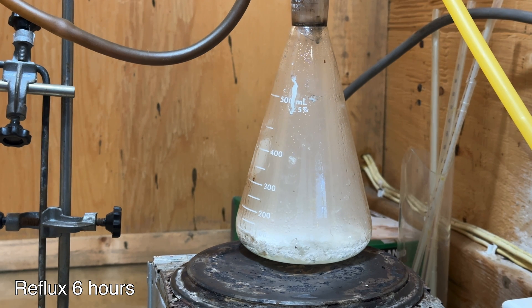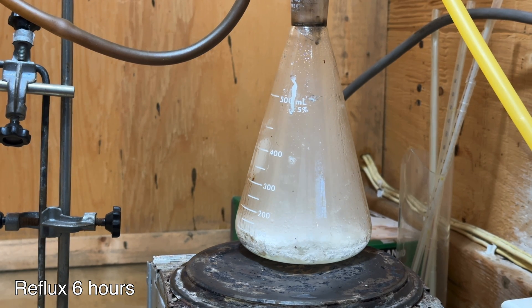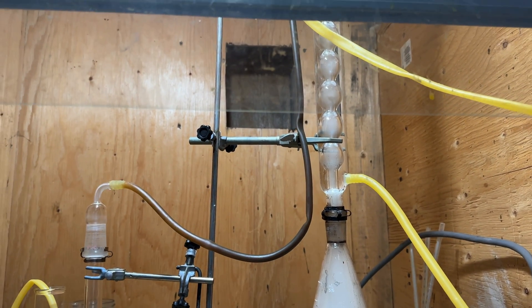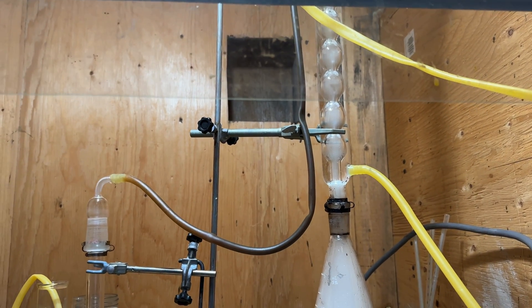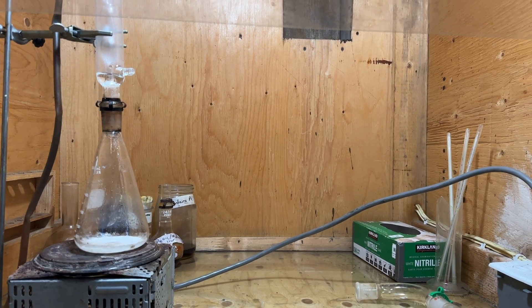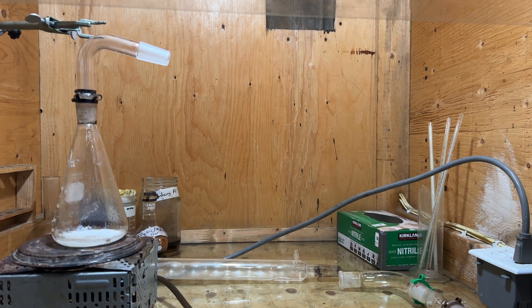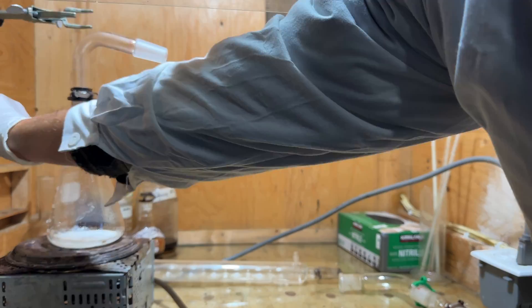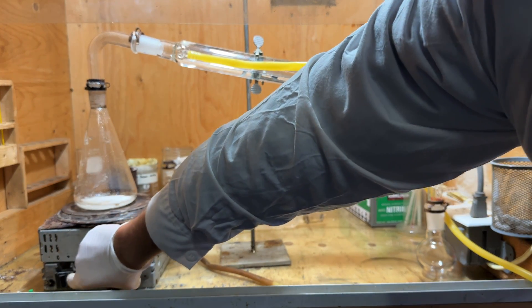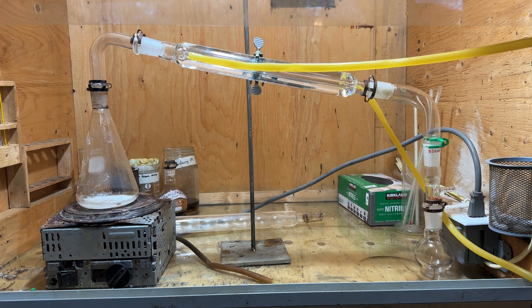After refluxing for six hours, an appreciable amount of white tin(IV) sulfate was present, and the mixture began to produce a dense white fog, suggesting all the tin(IV) chloride had been consumed and sulfuric acid was now vaporizing. The apparatus was cooled slightly to stop the sulfuric acid from vaporizing, and then a simple distillation apparatus was set up on the flask. It is important not to fully cool the mixture, as moisture in the air will be drawn back into the flask and reduce the yield.